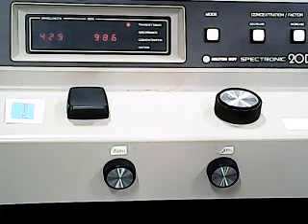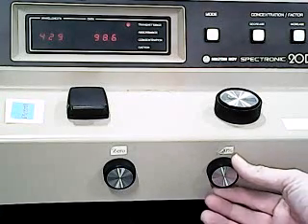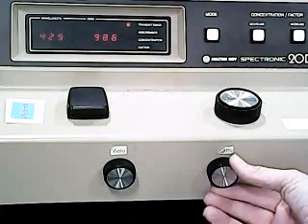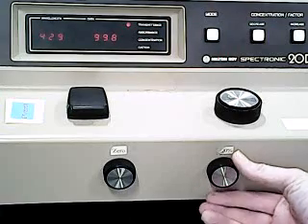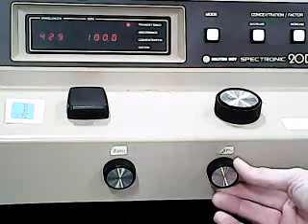This is why when you are setting up an instrument, you use a blank. That is, you use a solution that contains everything except the color species to see if those other things have some small absorbances. And so we are going to set our 100 not to distilled water, but to the test solutions without the iron in them, so that we get a reading of just the iron's absorbance, not everything else that's in the solution.